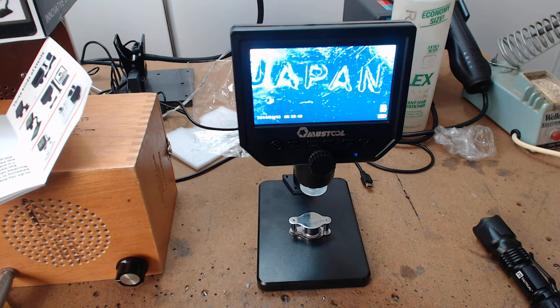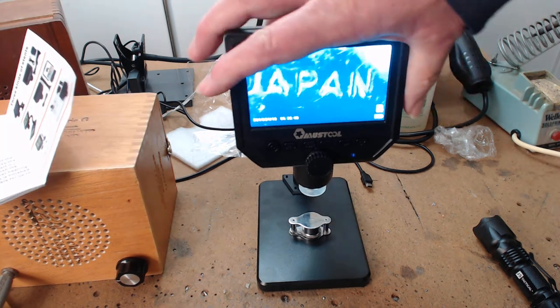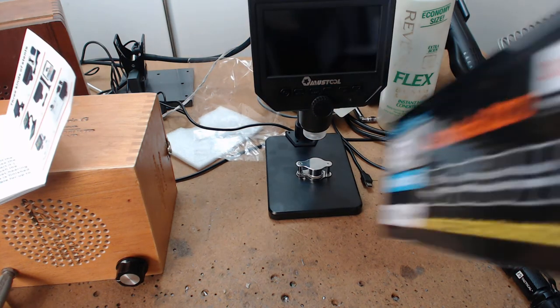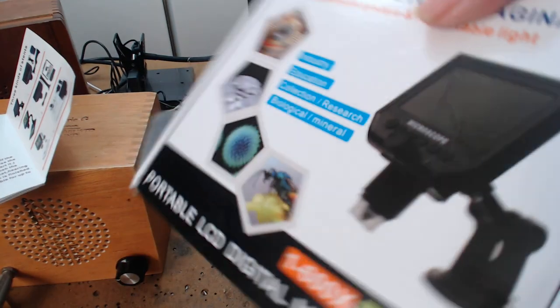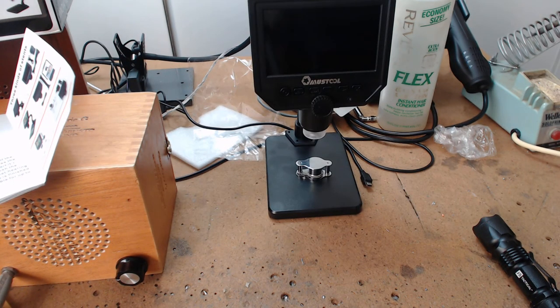I got the $58 microscope. And the person put up a picture, I can show you the picture they put up there. Let's shut this off. Why would you put battery operated? Well, anyway, that's the picture they put up, and that's what I got. And this is the picture on the box. So you're doomed right from the start. This is just to show you what would go wrong for you.